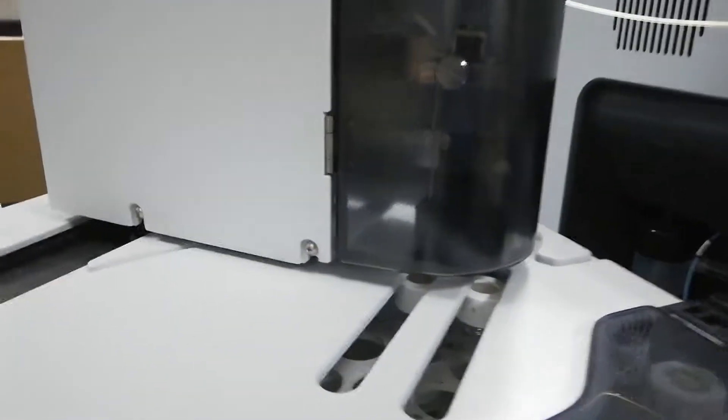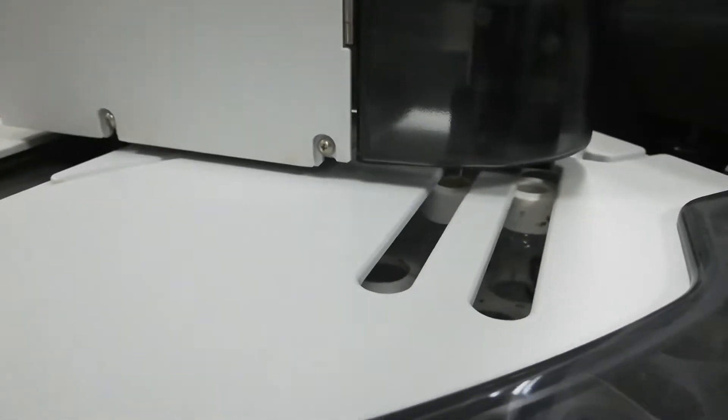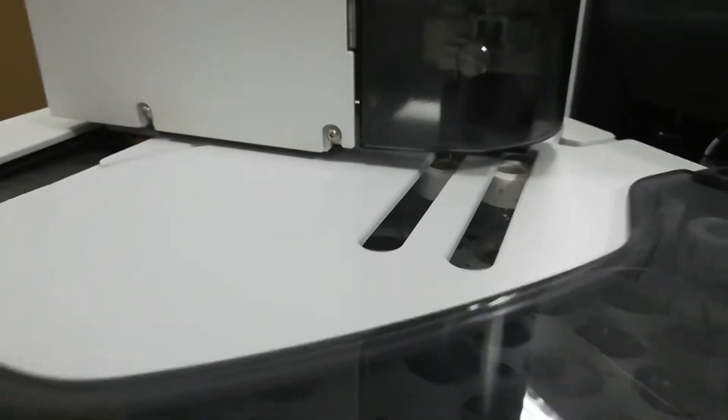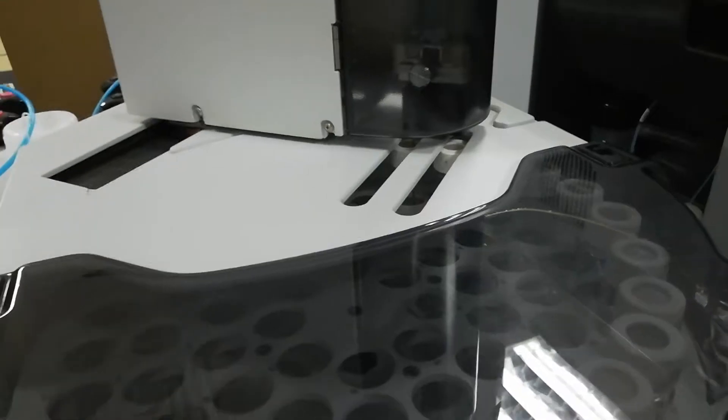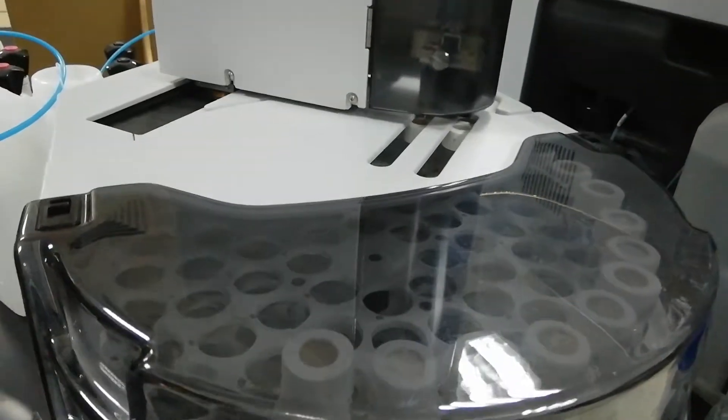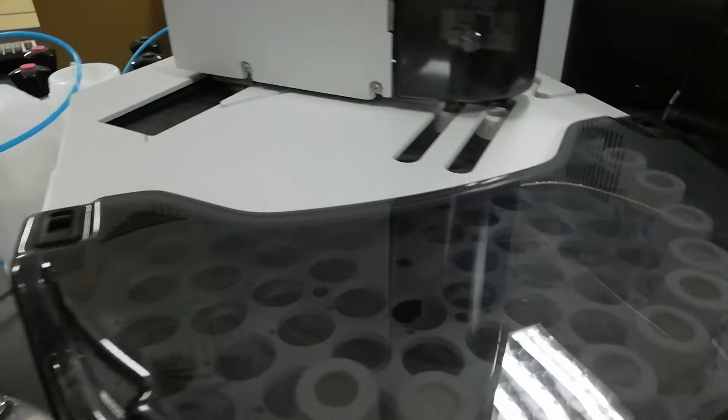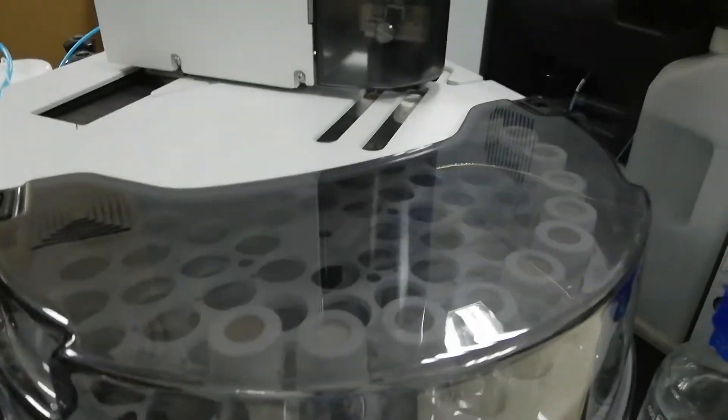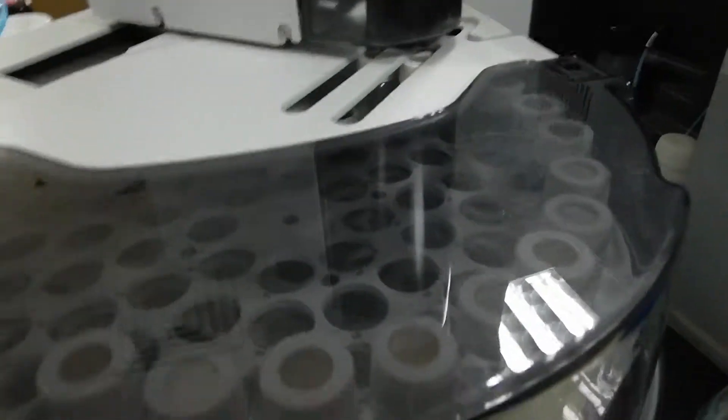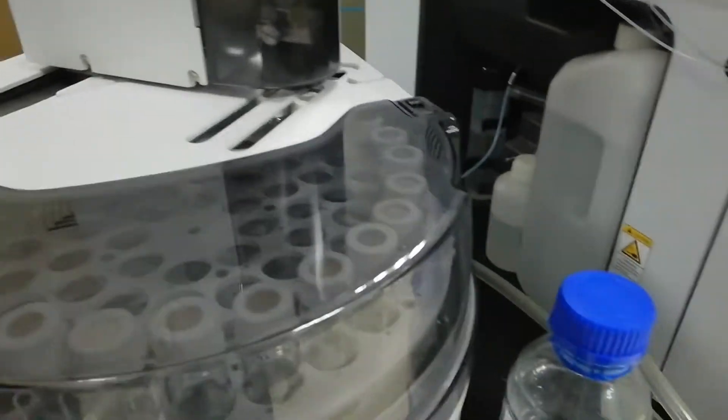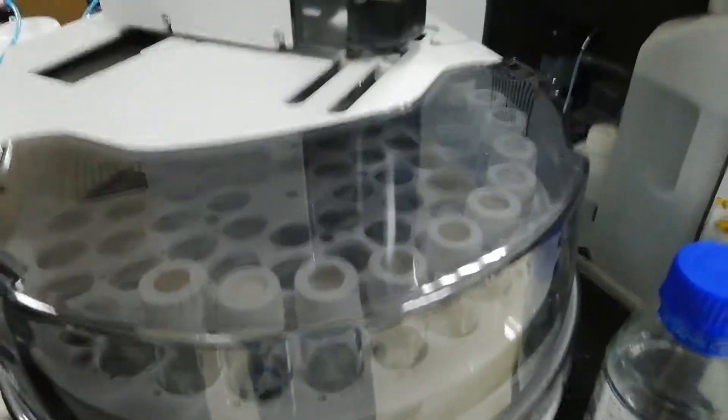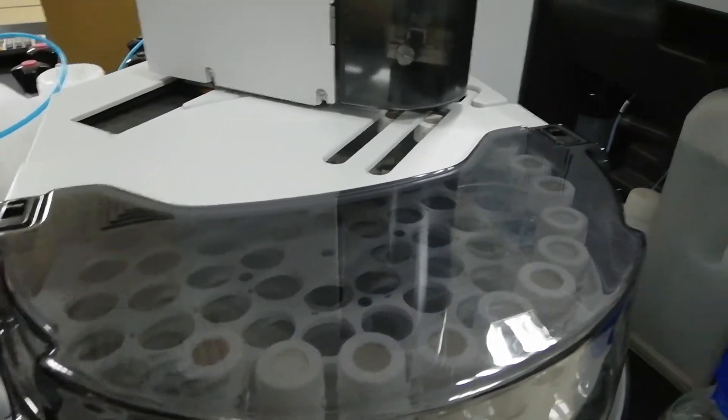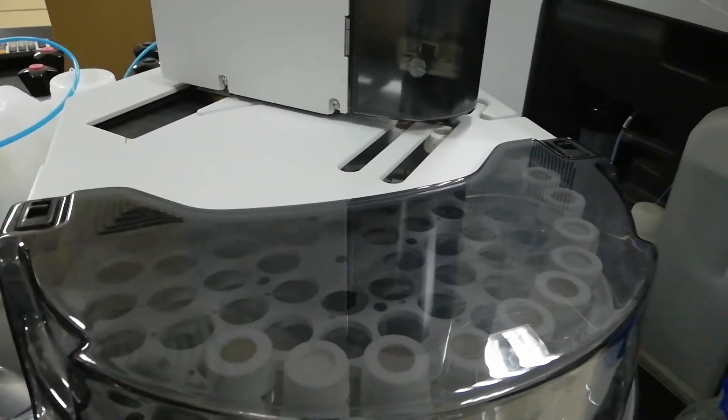You can check that the syringe is piercing in the vial, and now it will take the sample. So it has some specific time. Three to four times you can add it in your method - that how much replicates you want to run and how much it will take time. But approximately, as I told you earlier, that the analysis time for one sample is around about 17 to 20 minutes. So you have to wait for this. But almost after 17 to 20 minutes you will get the result, and this result you can record it.